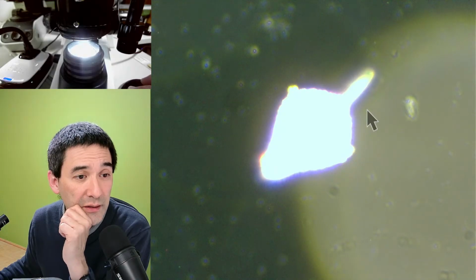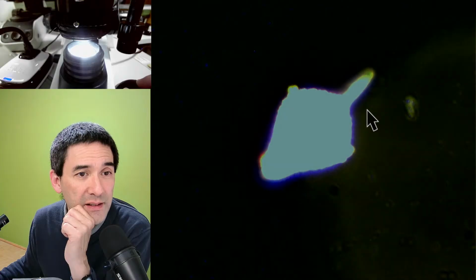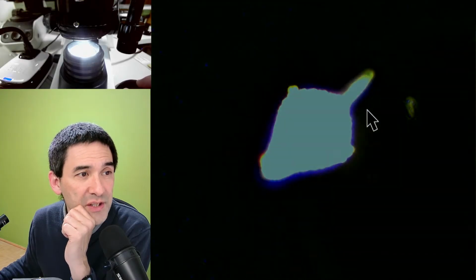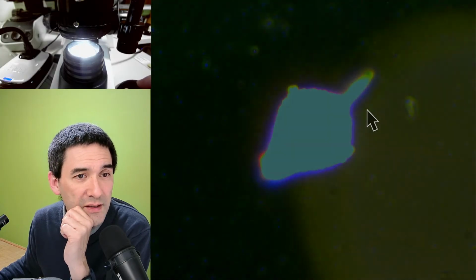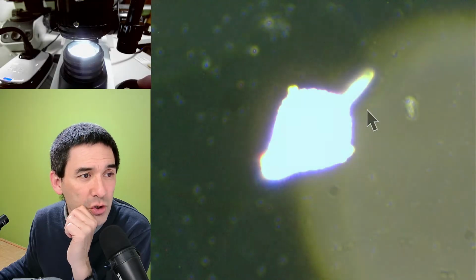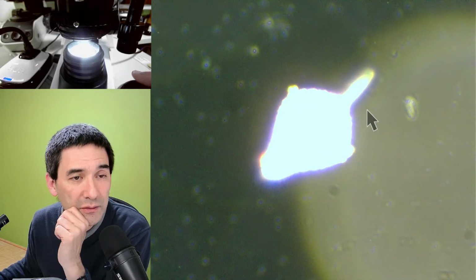I can show you, but the problem is, look, if I go down with the brightness, the whole image just becomes darker, but I will not see more details. If I change the contrast, I'm also not able to get more details. That has to do with the limited dynamic range of the camera, unfortunately.